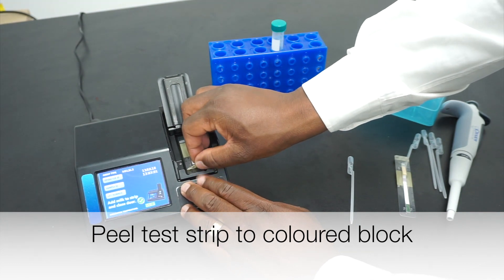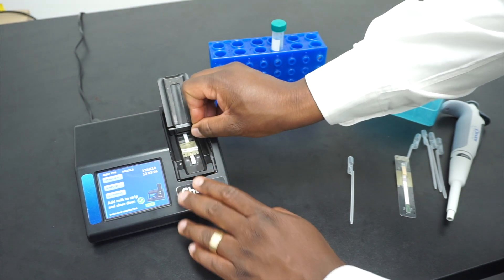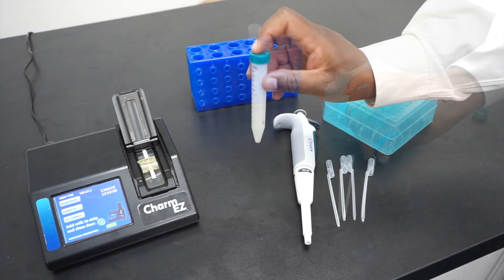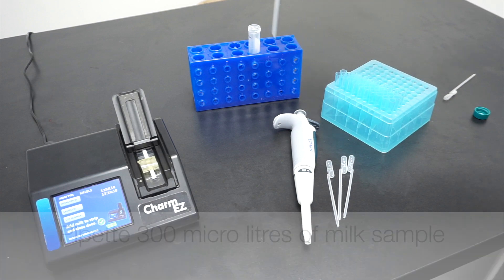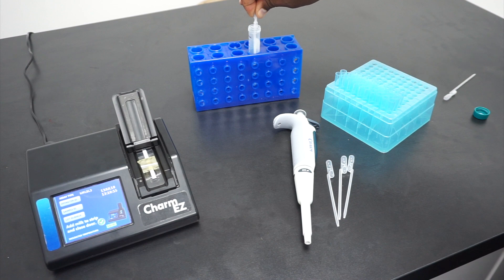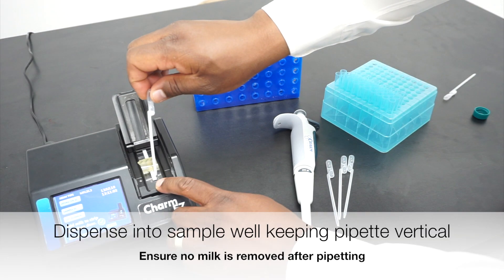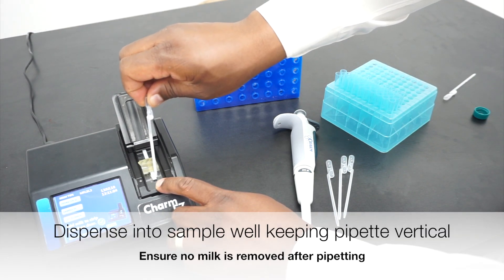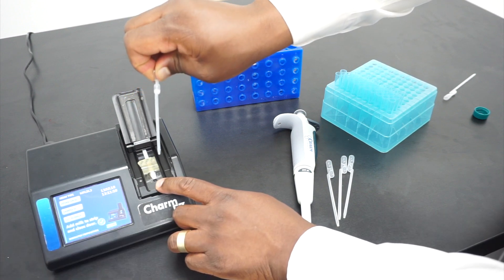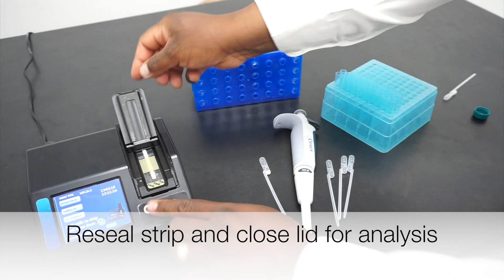Peel back the cover of your test strip to the colored block. Gently mix your milk to ensure you have a homogenous sample. Pipette 300 microliters of your milk into the sample well of your test strip. Re-seal your test strip and close the door.